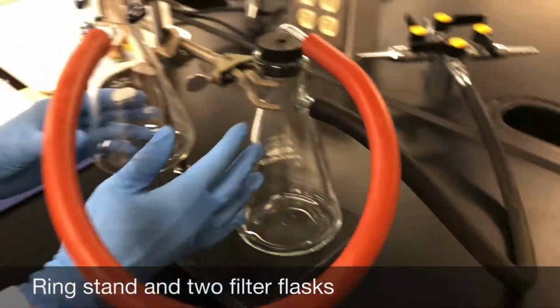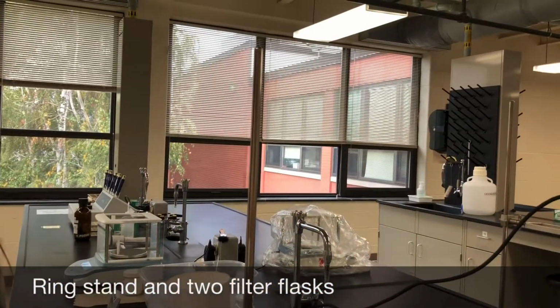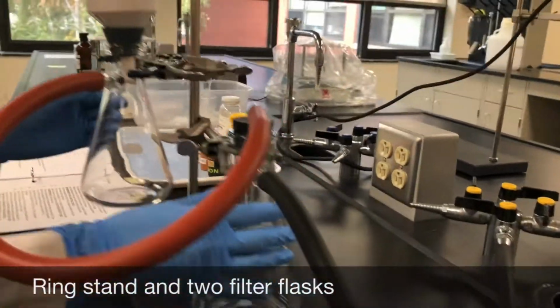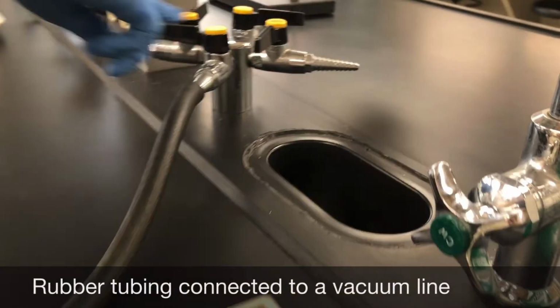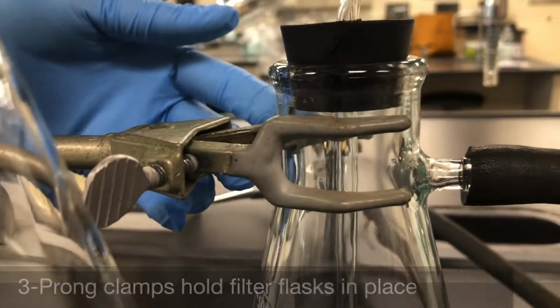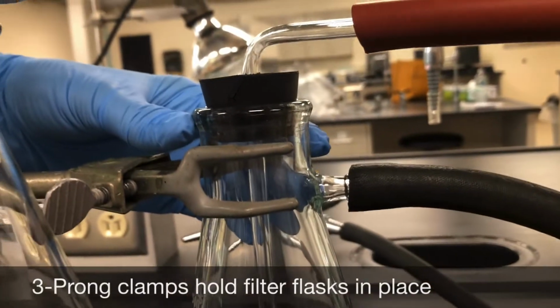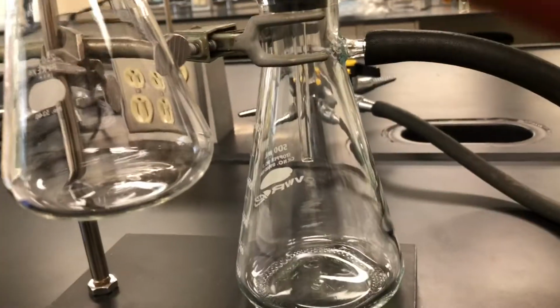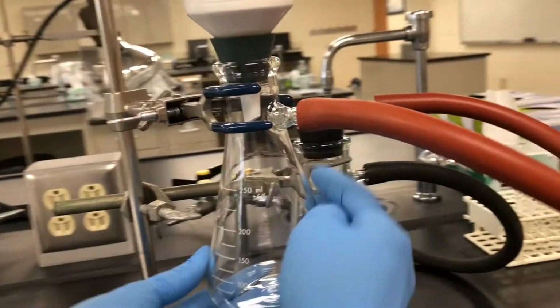Then we have 2 filter flasks with the side arms. So the first filter flask serves as a water trap, and it has a rubber tubing connected to the vacuum line. All right. Next, we have the 3-prong clamp to hold the filter flask in place. And then we have a smaller filter flask, again with the rubber tubing.